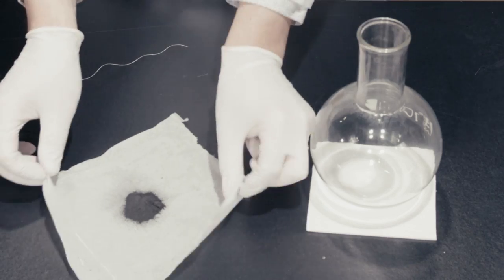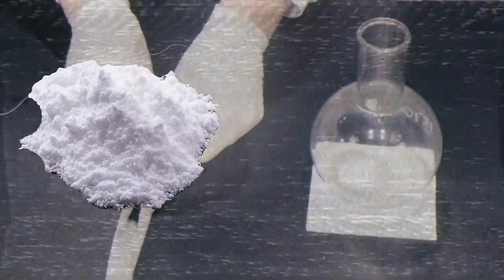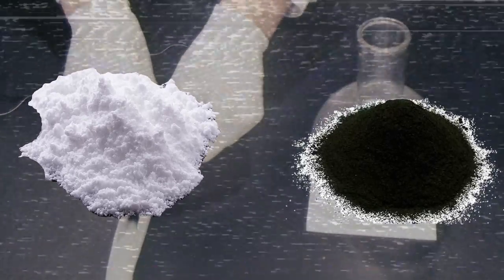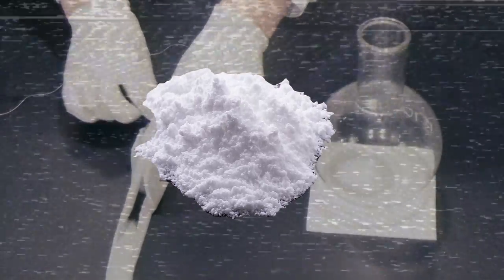Then I will go through the same experiment again, but without the aluminum foil so the students — and of course you, my lovely audience — can see what is really happening. Wait just one scientific second, Batman. Sodium iodide is white. This powder is gray. What gives? Well, what we're talking about is sodium iodide, but what we're looking at here is manganese dioxide. Both can work as a catalyst for the genie in a bottle experiment. I've already started talking about sodium iodide so I'm just going to keep on with that — just know what we're looking at here is manganese dioxide. This produces the same type of reaction: a decomposition reaction with a catalyst.